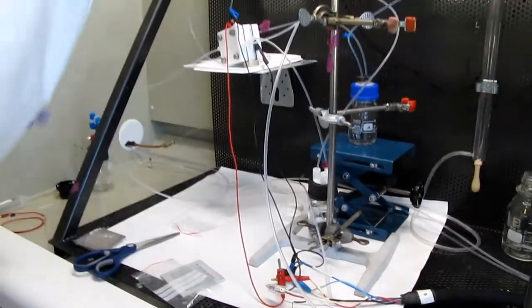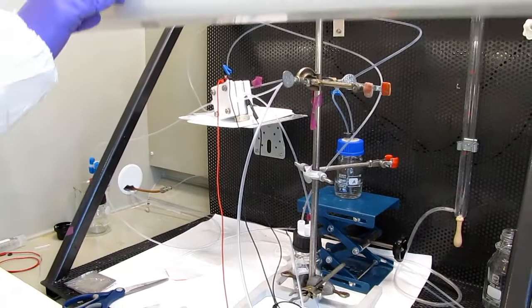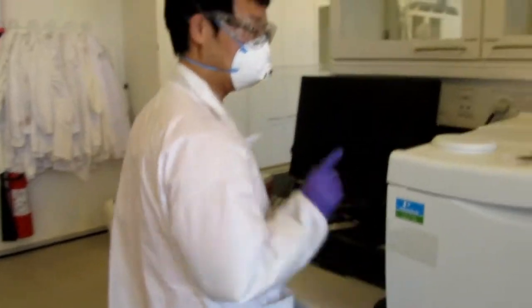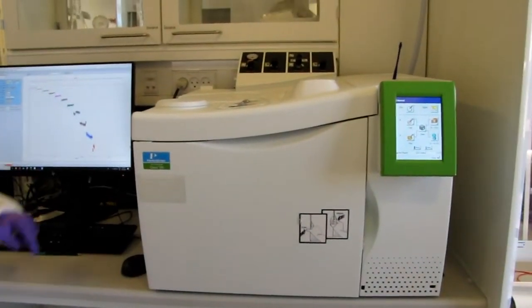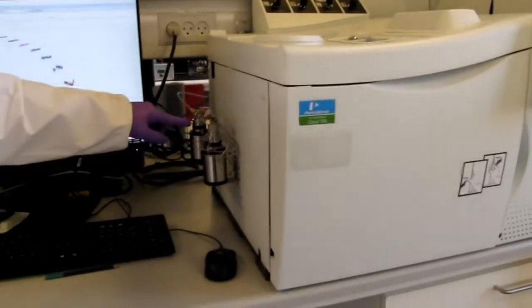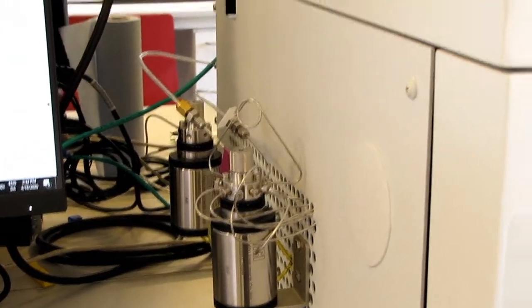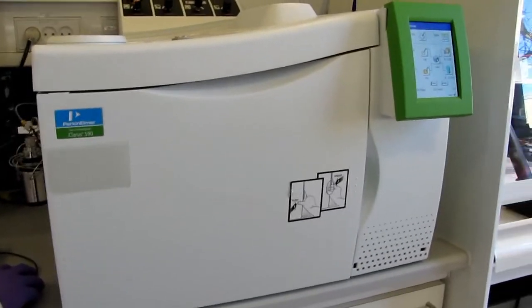Let's start. And all the GC — these are GC components. This is the switch port, this is the sample loop, switch port. We call it this thing.